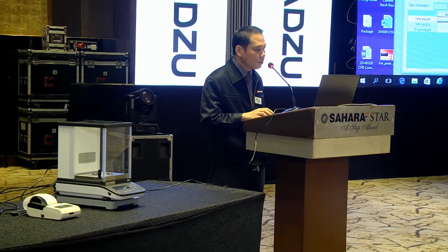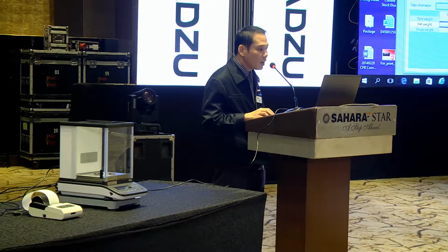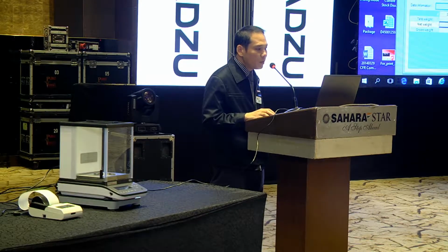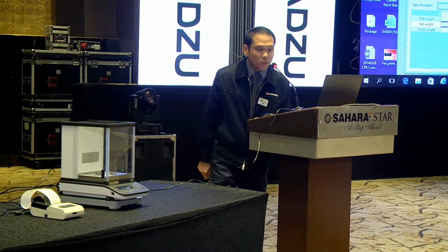Okay. So the container weight will be registered here. Next you need to tare, right? So you can use the function on the Lab Solution DB. You tare the balance. And you load the sample into the container.